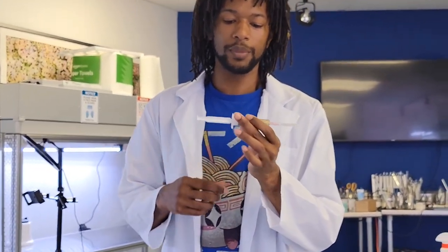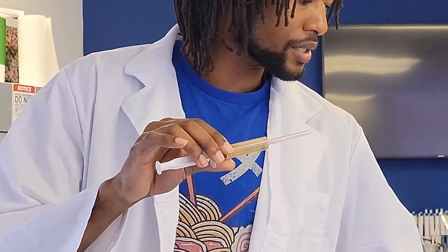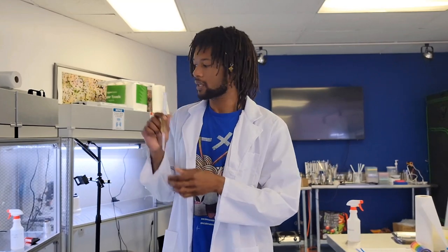We've also got another lion's mane. This one's already been cleaned up pretty well and this is mycelium just like what's on these plates, but this is just in a liquid culture. It's kept sterile by keeping it in a sterile syringe. So what we're going to do is sterilize the needle and shoot some of this onto the plate. It should be clean, but you can never be too safe when you're growing in liquids.